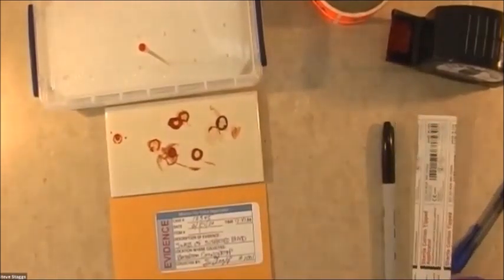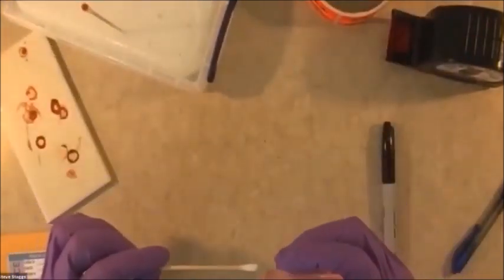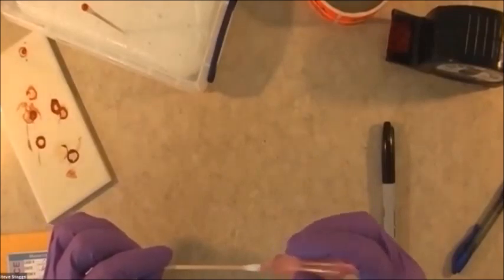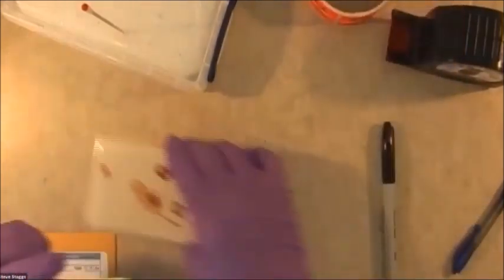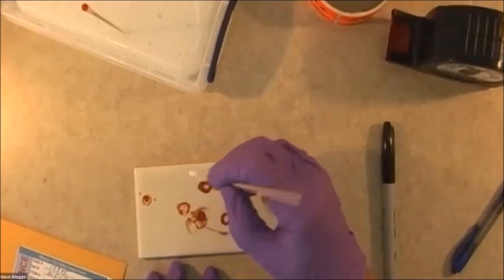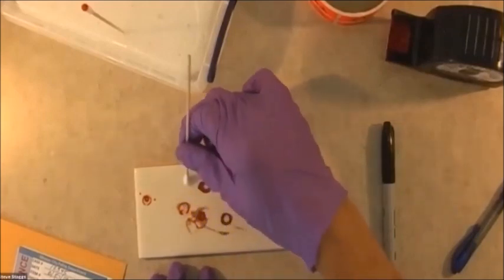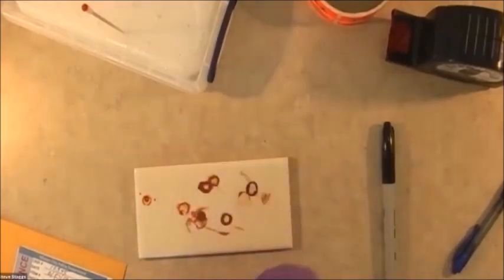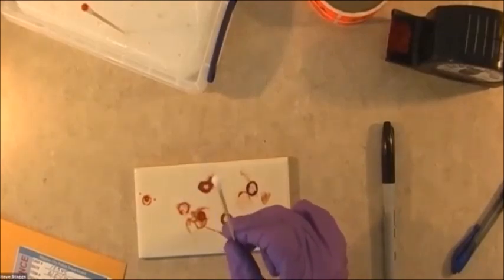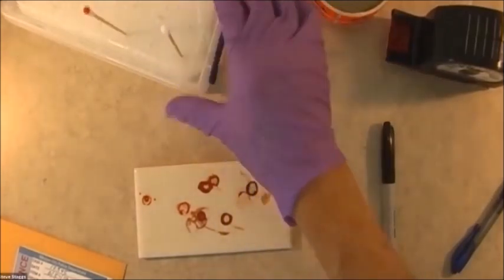Now I need to do one more thing — I need to take a control sample. So I'm going to open a second swab, or if there were two in the container, I just take the second one. Again, I'm going to put two drops of distilled water on it. For my control sample, I'm going to sample away from but on the same surface, away from the evidence. It's the tip of the swab you want. Normally you can't see anything — you shouldn't see any blood or suspected blood. Then you put that also into your drying rack.